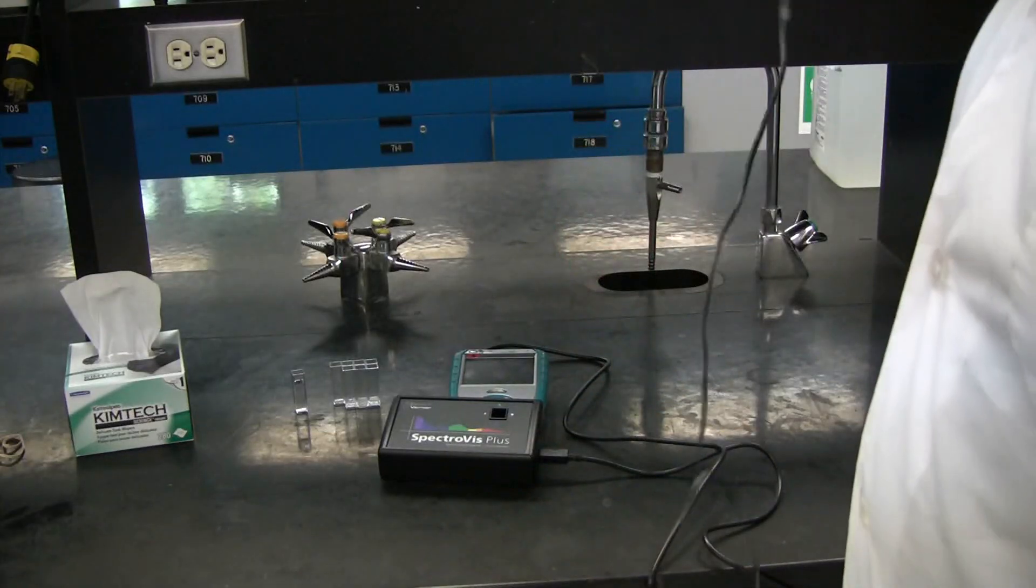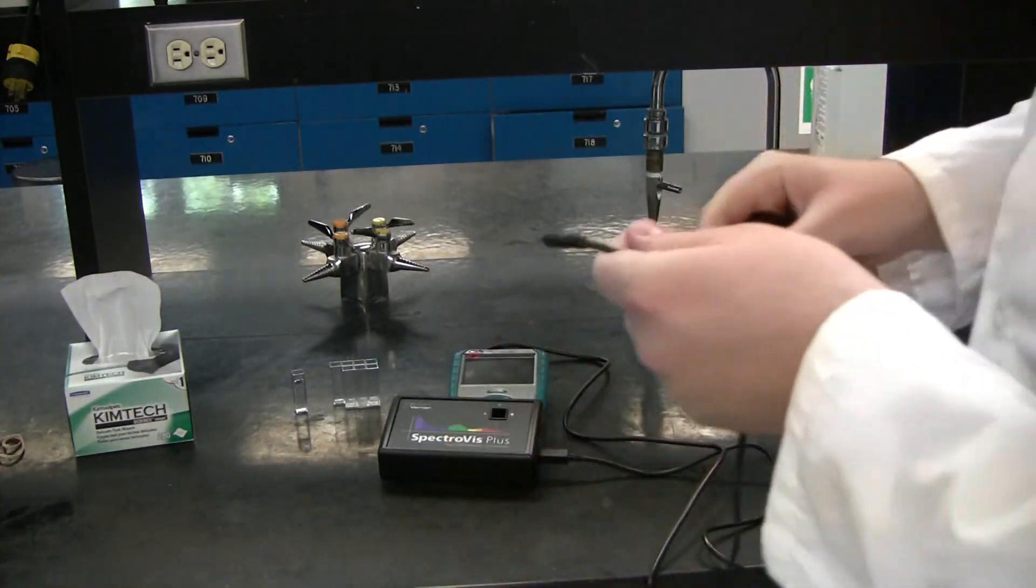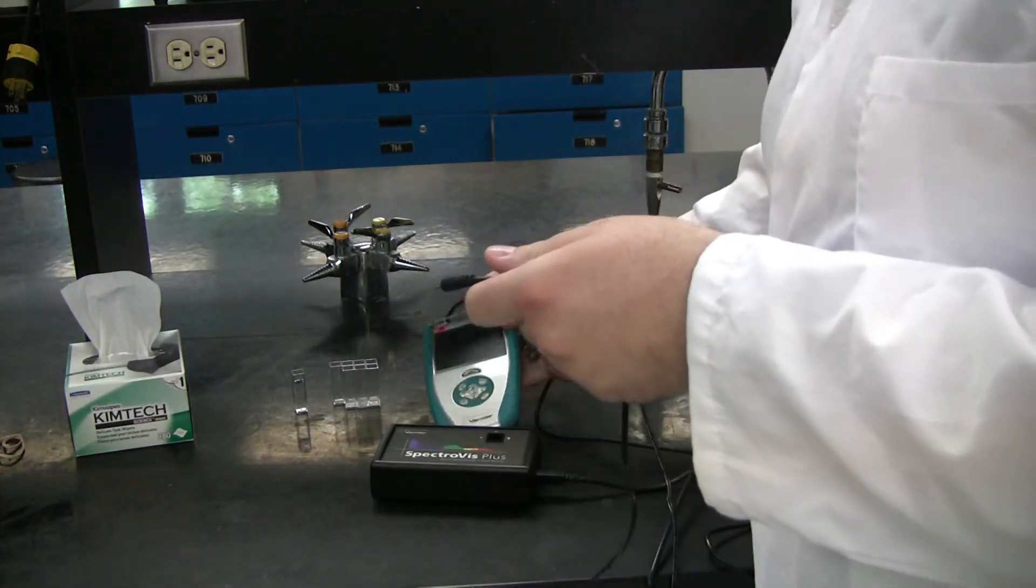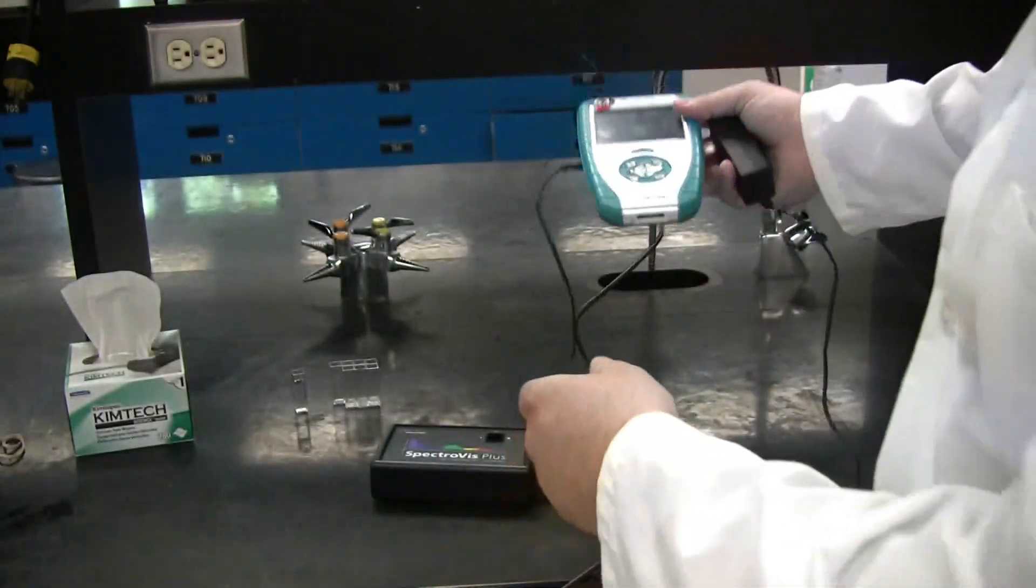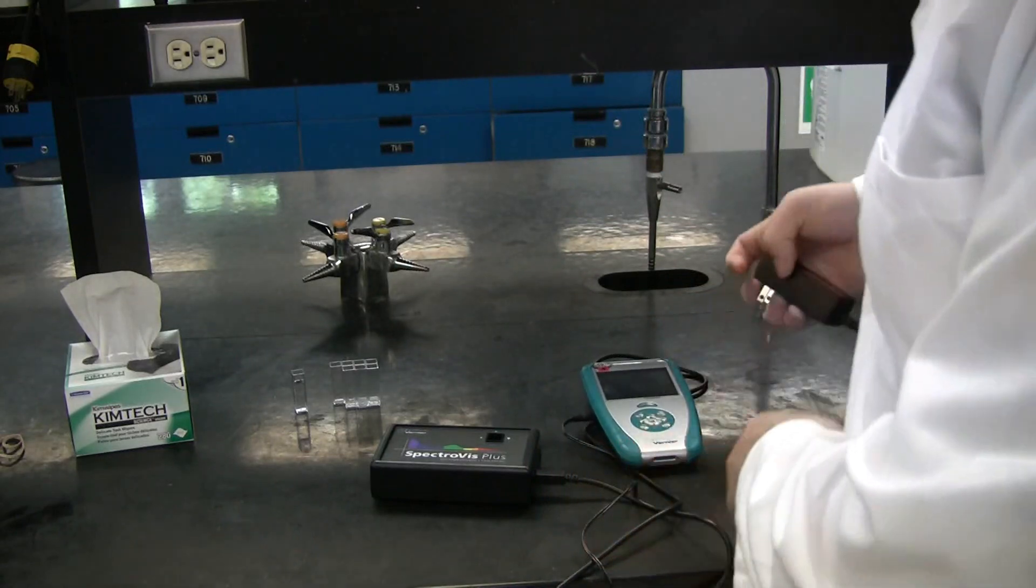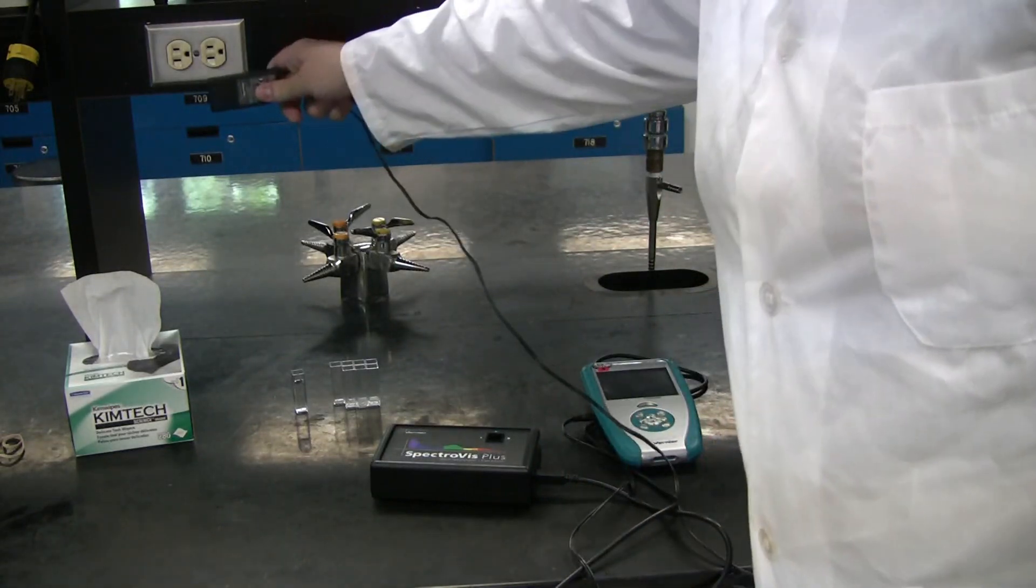Now, plug in the charger into this spot on the LabQuest. Proceed to plug in the charger into a wall outlet.